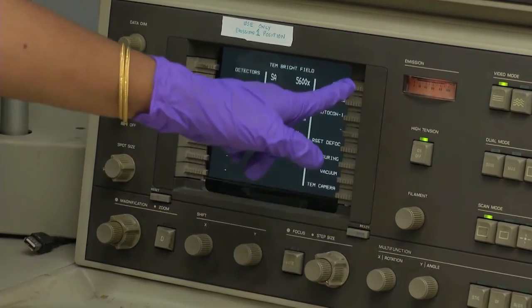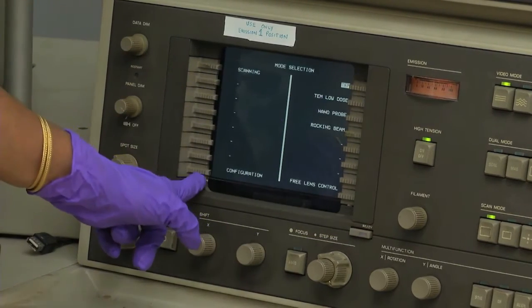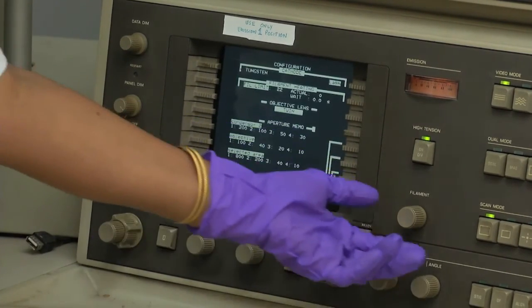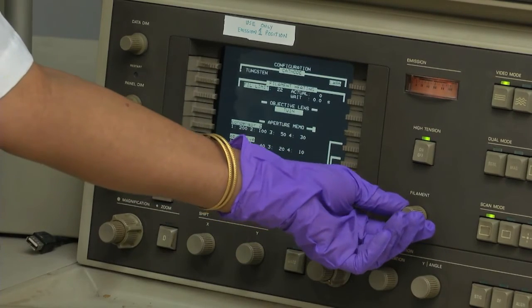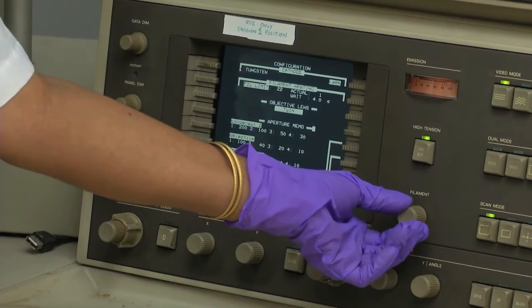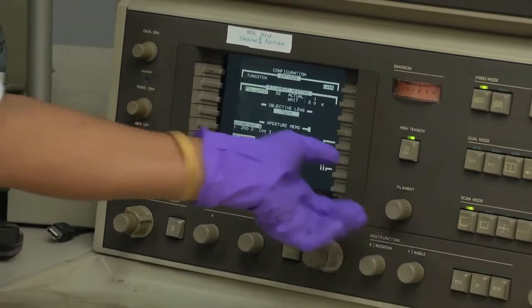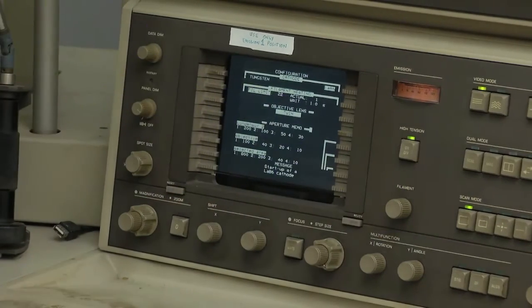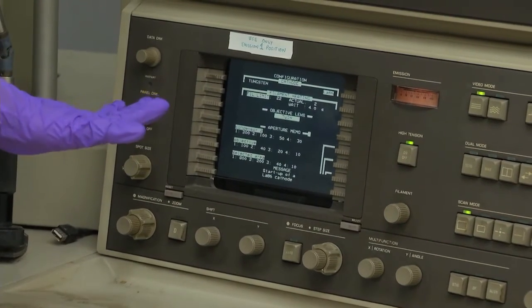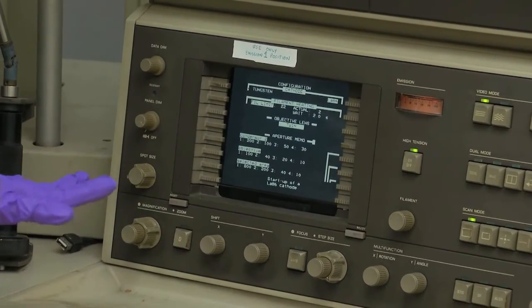Then you have to heat the filament — this is thermionic emission. I am now heating the filament. You have to wait until maximum electron emission is achieved.